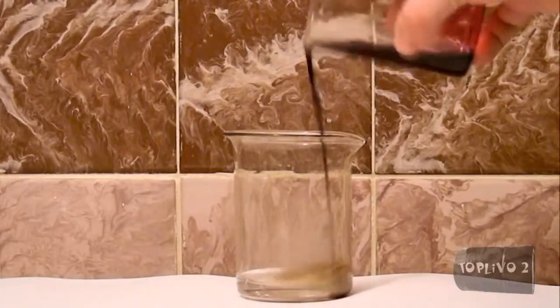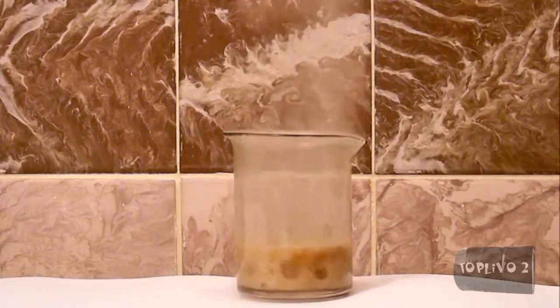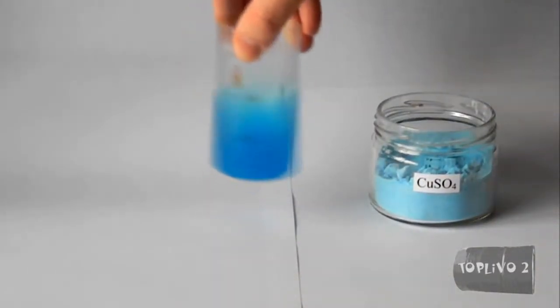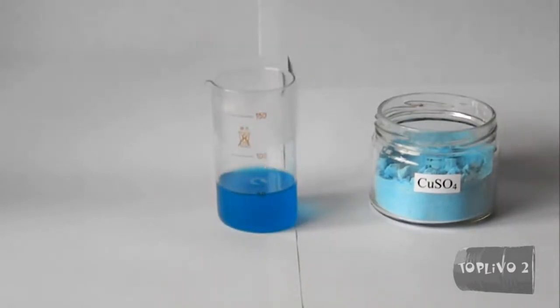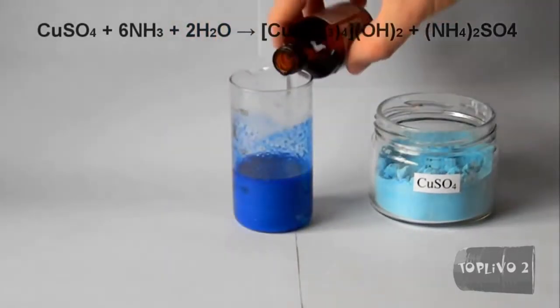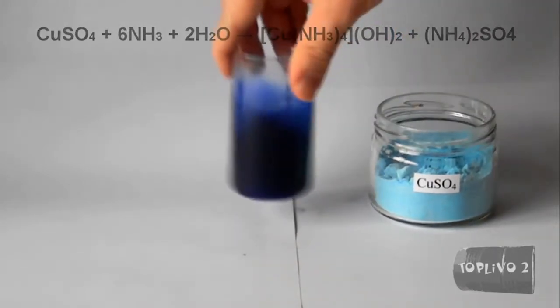Hydrogen peroxide decomposes in the presence of a catalyst. The catalyst can be either potassium permanganate or copper ammoniate. First, let's prepare our catalysts. Take copper sulfate and dissolve it in water. Next, add ammonium hydroxide to the solution. Continue pouring until the solution becomes blue and transparent. Here we have got our copper ammoniate catalyst.